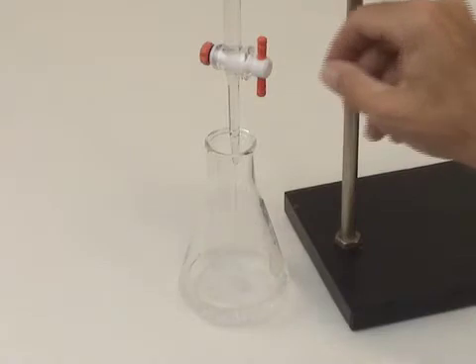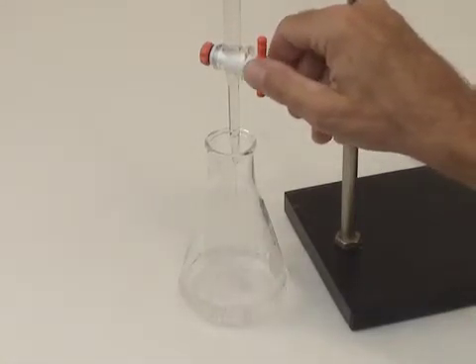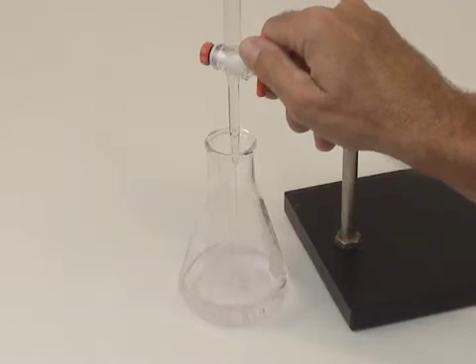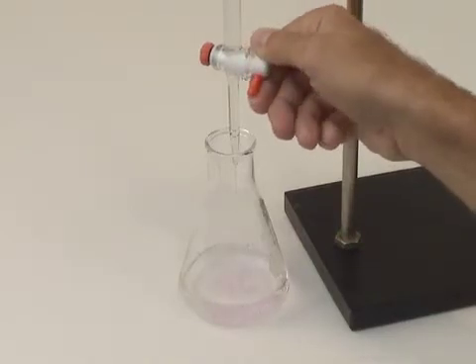Keep an eye on the solution. You'll notice that the indicator color, the pink color that develops, will occupy a larger and larger volume. After shutting off the stopcock, mix the solution thoroughly. The pink color should now disappear. The solution should turn clear.